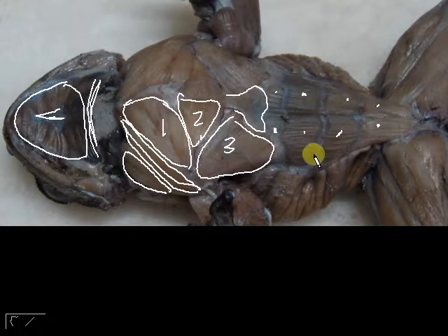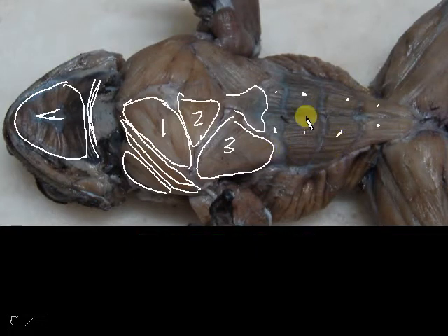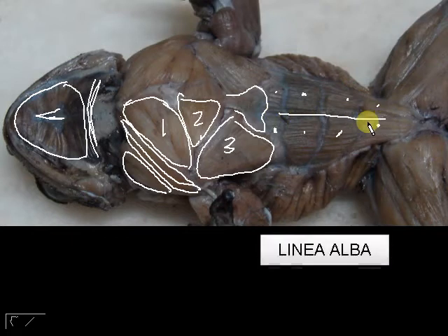abs. This would be your rectus abdominis. Rectus abdominis muscles. And then right down the middle, you will see a line. It's not a muscle, just a line. They call it the linea alba, because if you look at the toad freshly dissected, it is actually a white line.